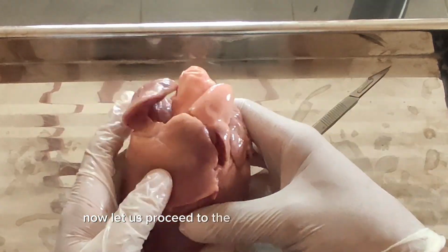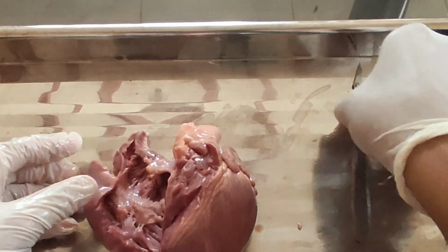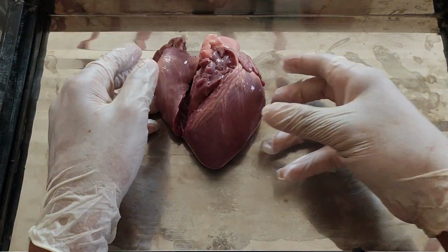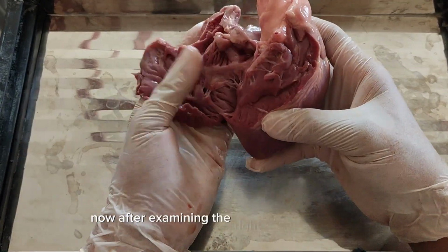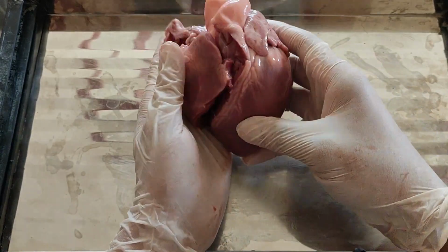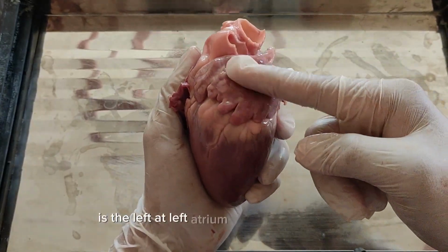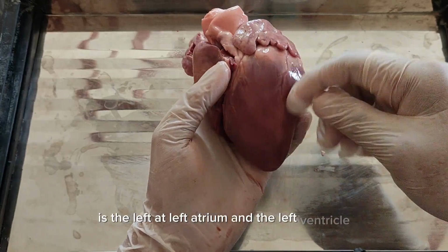Now let us proceed to the next incision or cutting. After examining the right part of the heart, let us proceed to the left part of our heart, which is the left atrium and the left ventricle.